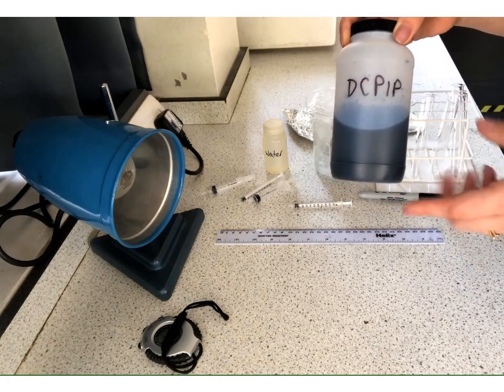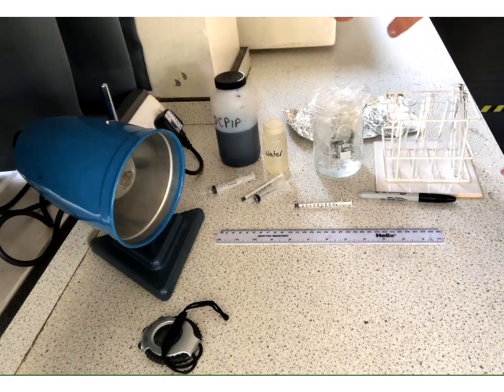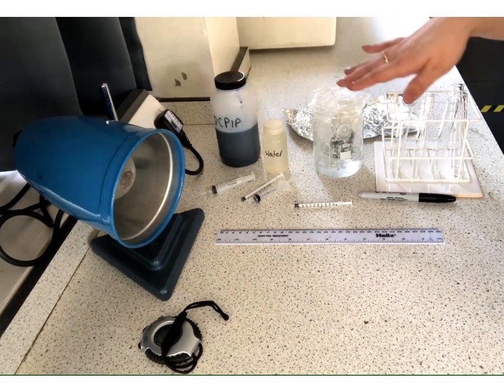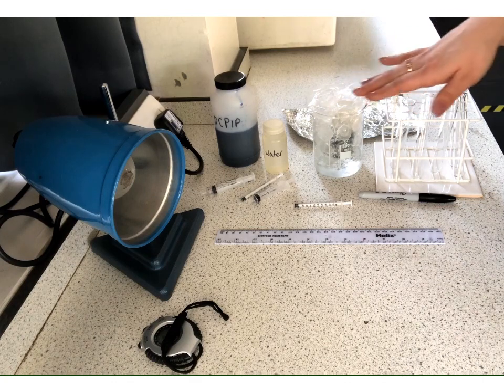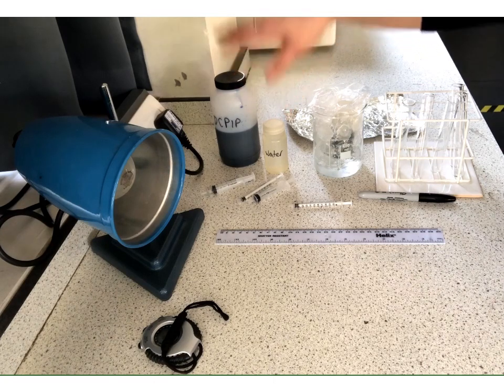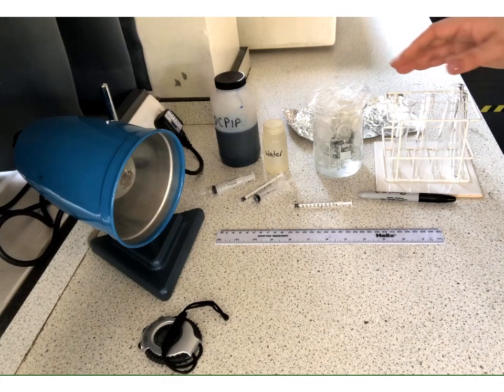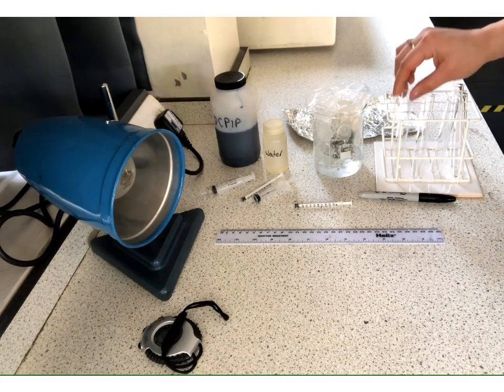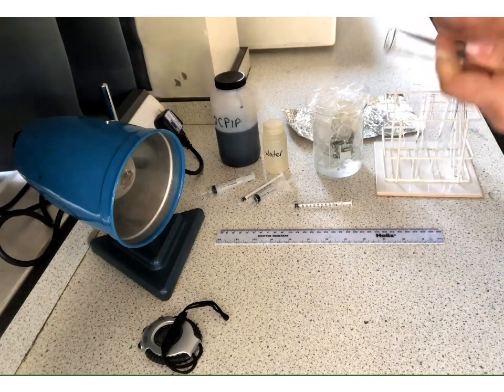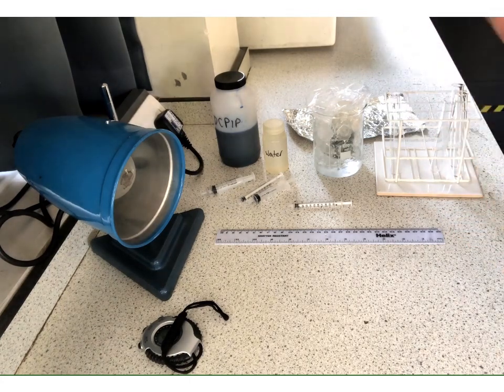Now, obviously, we are going to be mixing this with chloroplasts and therefore chlorophyll. So these are going to be quite green. So we're not looking for something to go blue to colourless. So this is why we're going to have a comparative tube. But instead we're going to be looking for a bluish green, okay, changing to more of a pure green. Okay, so we'll run through the steps involved. What we're going to do first of all is we're going to set up a couple of controls. So we're going to take these test tubes and we are going to label one of them as A, okay, and the other as B.